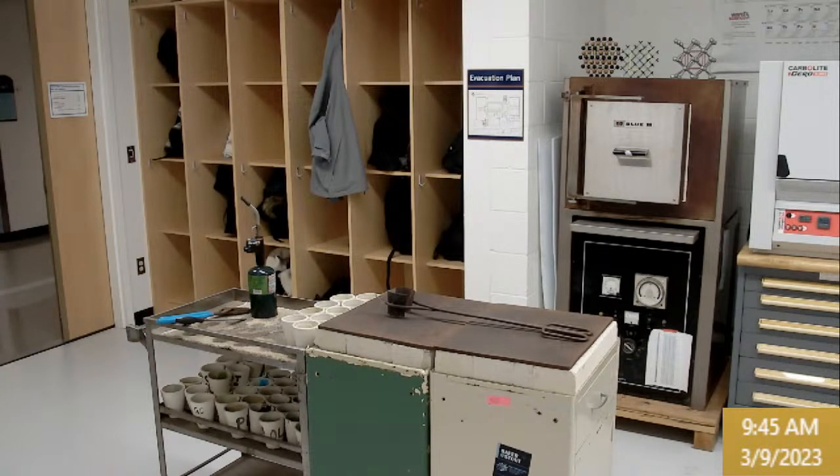I've got a firing diagram that shows what batch is where, and that way I'll be able to coordinate and describe the composition of that batch before we pour it, so we'll know what to look for.